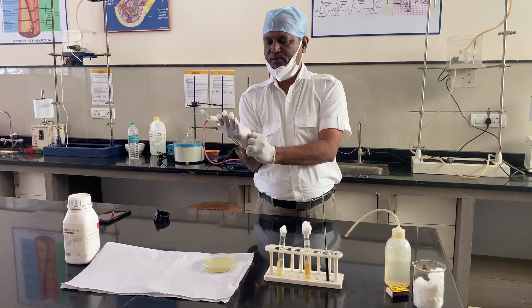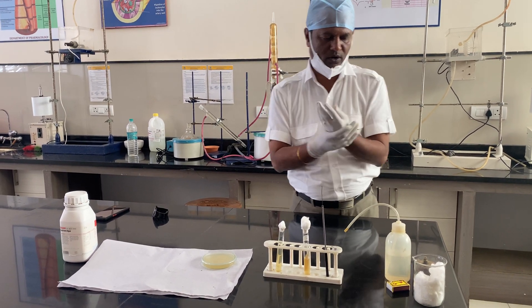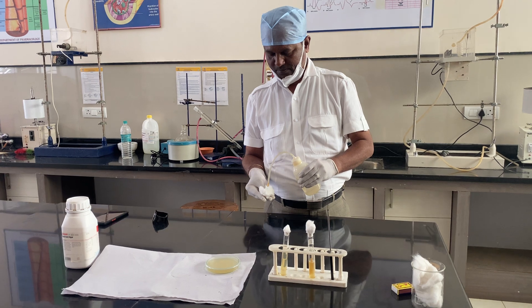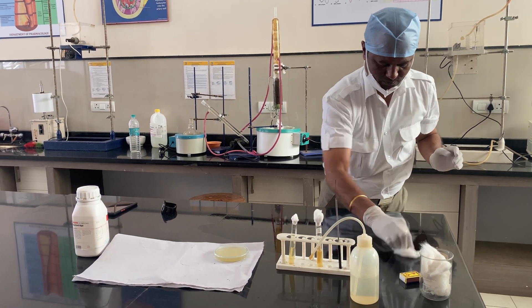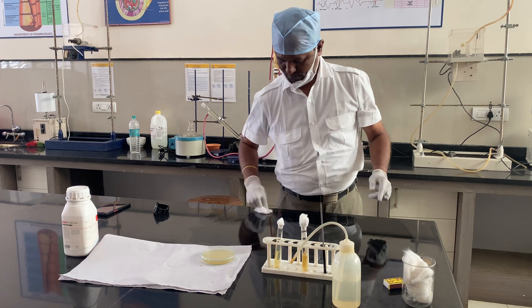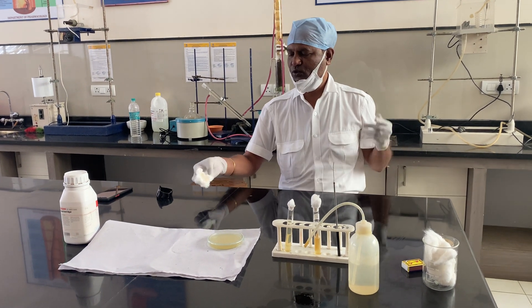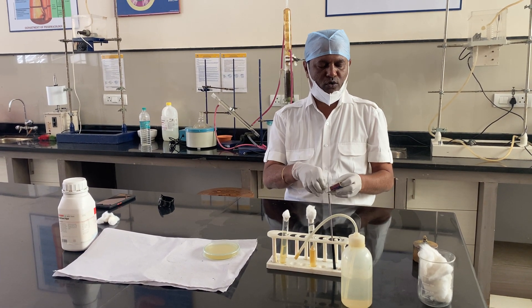Initially, we are supposed to keep the working place clean in order to avoid any sort of contamination. I am going to clean the working table with the help of some alcohol. We need to wait for one to two minutes because alcohol is flammable and the lamp will be on, so some precautions are necessary.